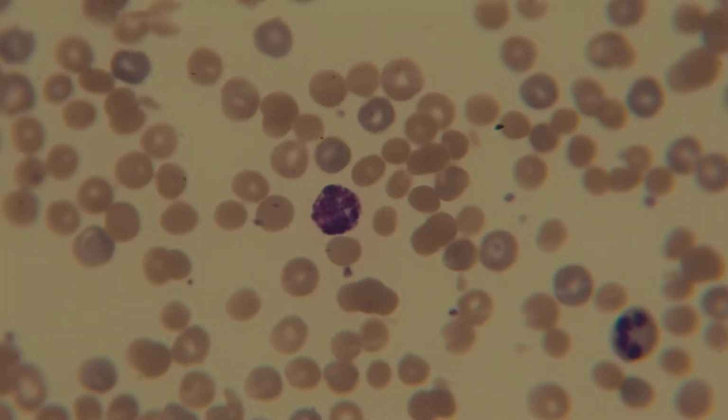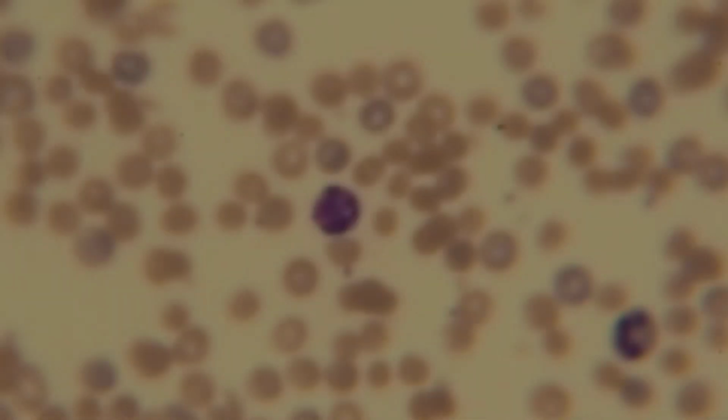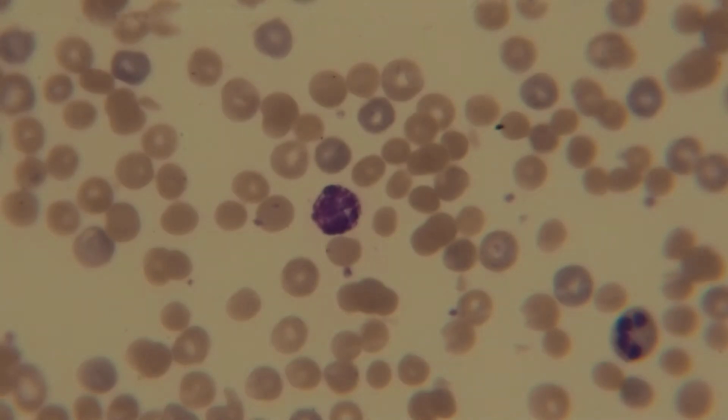You still see the beady, globular, and to see if something is globular, remember, you want a 3D picture, not a 2D picture of it. And to get a 3D picture, you actually have to move around the micro focus, because otherwise you don't have depth perception.